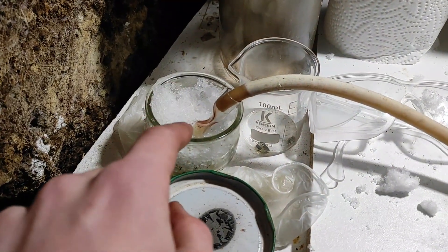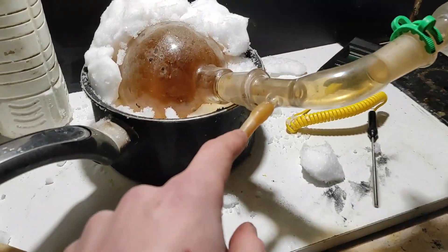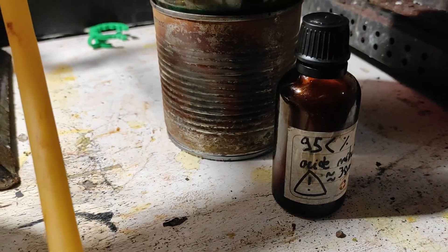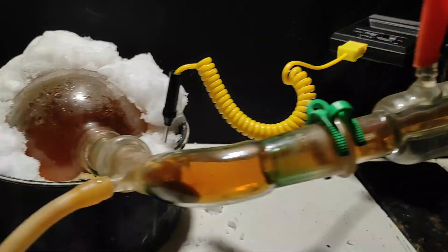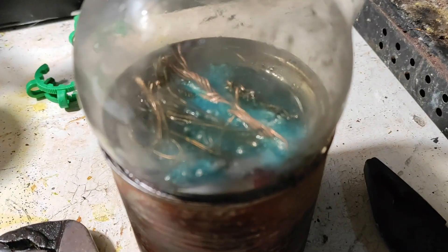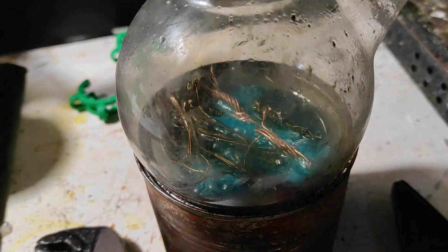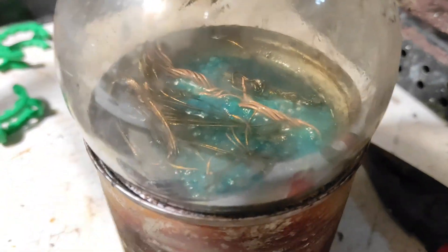The nitrogen dioxide generation was too slow and I could not condense any with the sulfuric acid method, so instead I decided to use my valuable concentrated nitric acid. And oh boy, it worked brilliantly. I immediately condensed a bunch of nitrogen oxide and the flask even looked red. So at the bottom of the receiving flask, we can very well see the bluish color of the dinitrogen trioxide — it's not completely blue because it's made with some NO2 as well. When the reaction is finished, you can actually see the copper nitrate precipitating out, and we've got a nice precipitation that's looking very good.